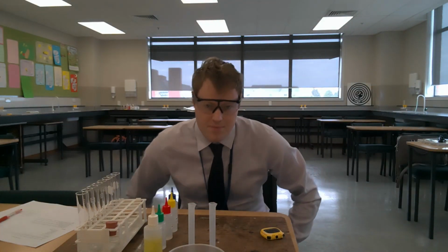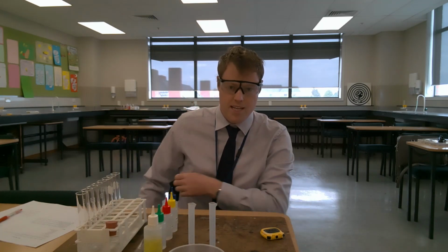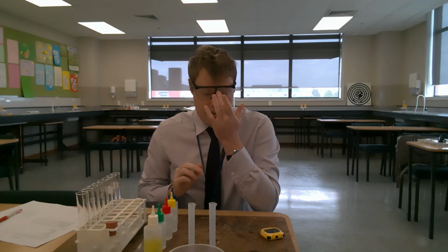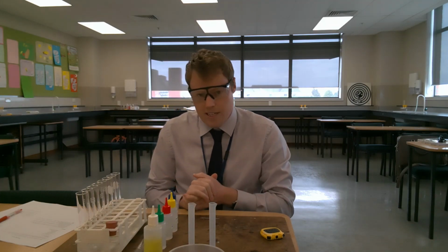Right, welcome to the Year 9 practical examination. My name is Mr. Brown and I will be completing the practical part of the examination on your behalf. You need to watch this video for two reasons.